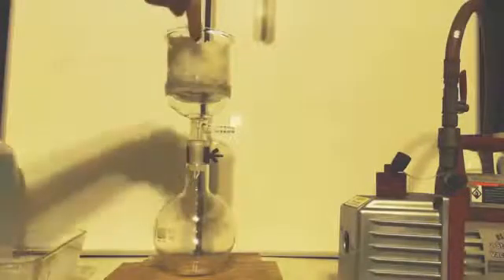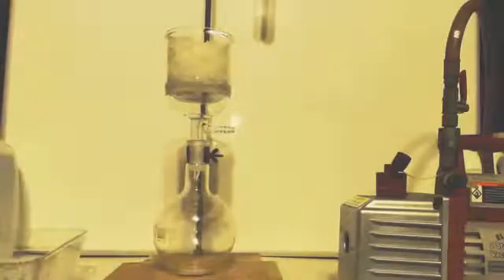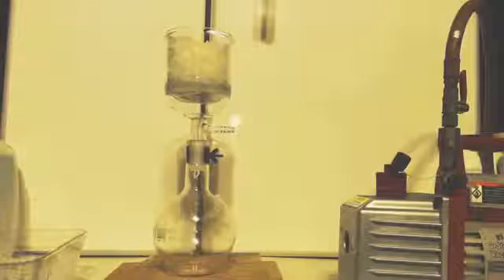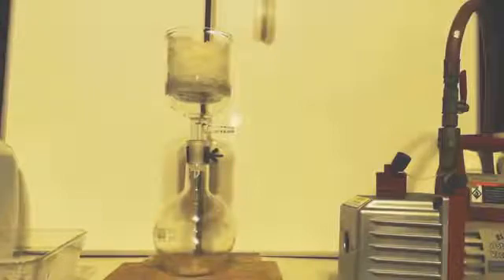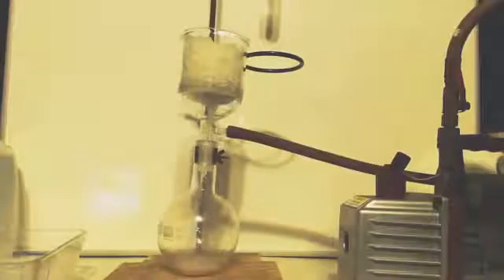Just want you to check out these crystals. You can see I got the crystals up in here and it's already starting to drip because it was like slush, like ice slush. I've greased my joint because I broke so many of them trying to get the hose back off - I learned to grease it every time.